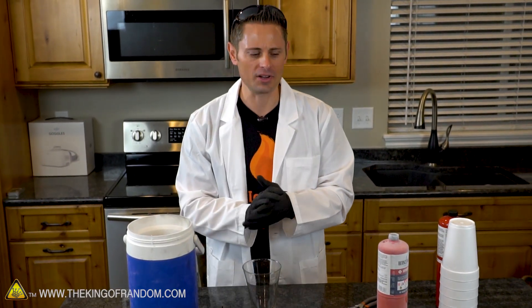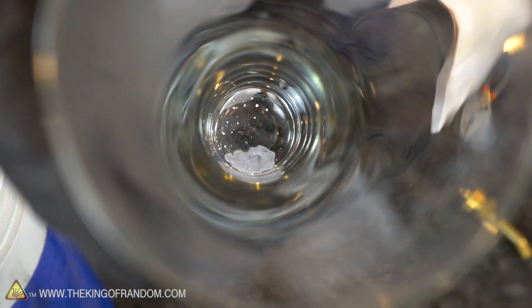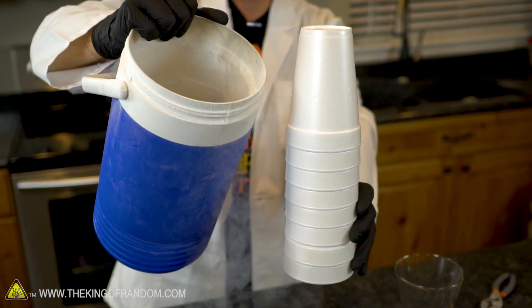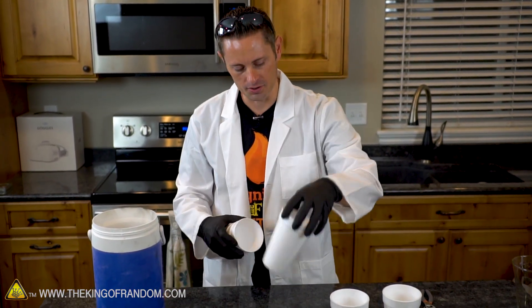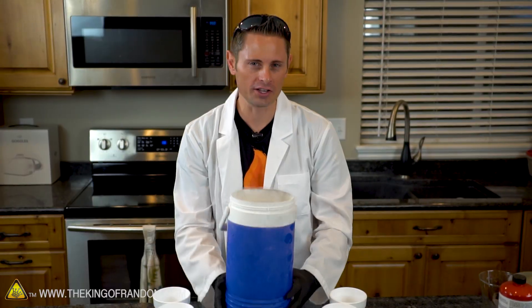Because it's very cheap, very economical - you certainly get a lot more than an ounce and a half. So what exactly do we need to generate liquid oxygen? Well surprisingly the only materials we're going to need are a canister of liquid nitrogen and some styrofoam cups. Go ahead and grab yourself a styrofoam cup - in this case I'm using eight just to speed the process. We're going to lay them all out across the counter.